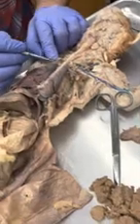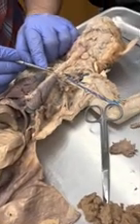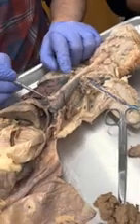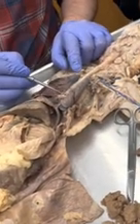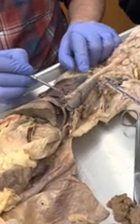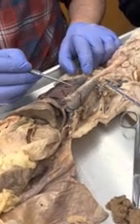So there's the trachea, and right below it, that's the esophagus. When the trachea comes down here, it's going to branch, and we have a bronchus right there, and a bronchus right there. So that's the left bronchus, there's the right bronchus.